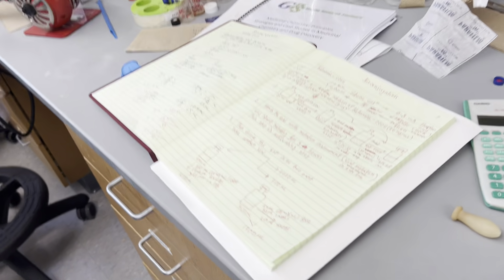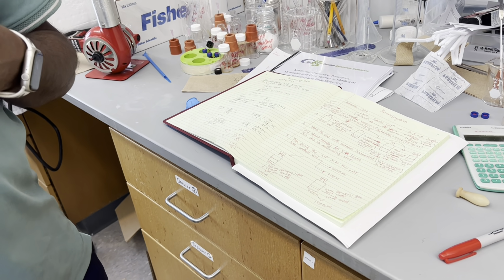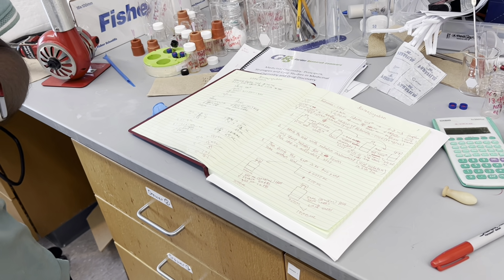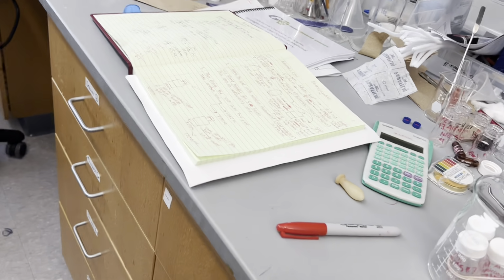But while you are measuring BSA as a solid, suppose you come up with 11 milligrams. Oh, okay. So you have to add 550 microliters of the water. Right. Not water, actually. You will use 1x PBS to dissolve. Oh, that. Well, we have enough 1x. We already diluted earlier. Yes, we had a lot. Yeah, enough. Okay.